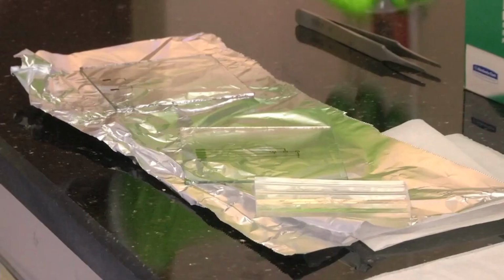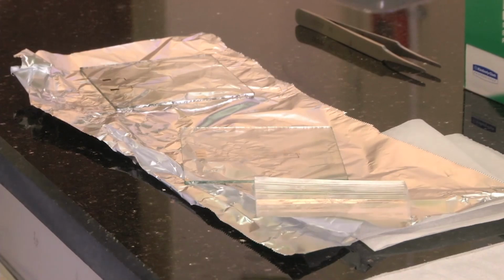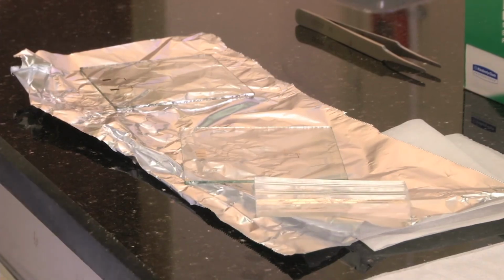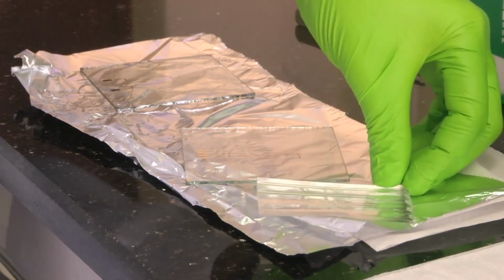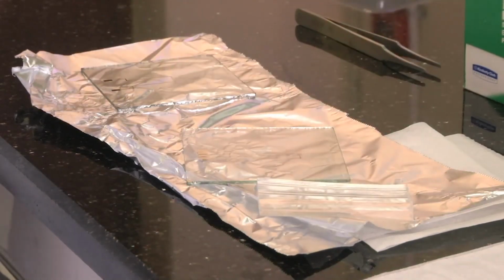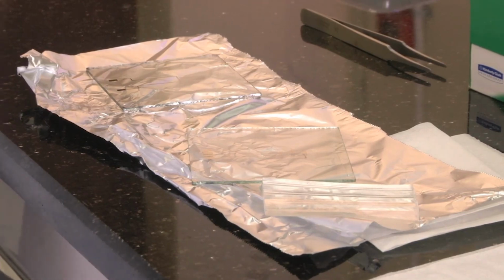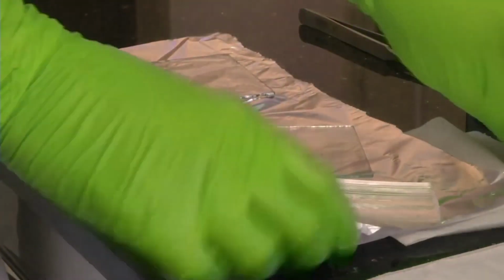So how do we bond PDMS membrane to glass? That is done through a method called oxygen plasma bonding. So we have fabricated the PDMS mold, as you have seen. So you have understood the whole process, and how important each process is. So once the membrane or the channels are ready in the PDMS, we can bond or stick. Stick is the colloquial word. If you are working in a technical field, you should use the technical term. So that is bonding. You need to bond your PDMS membrane with a substrate.